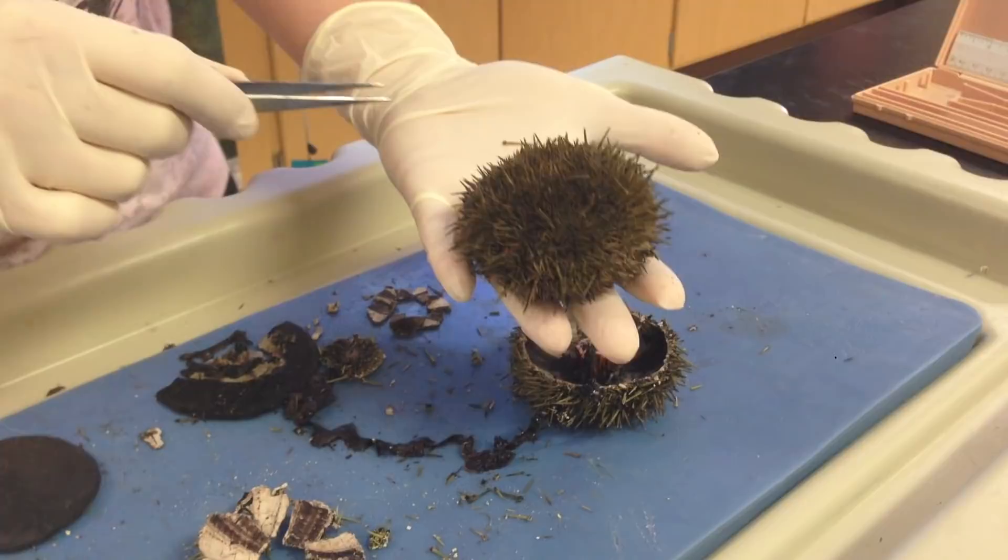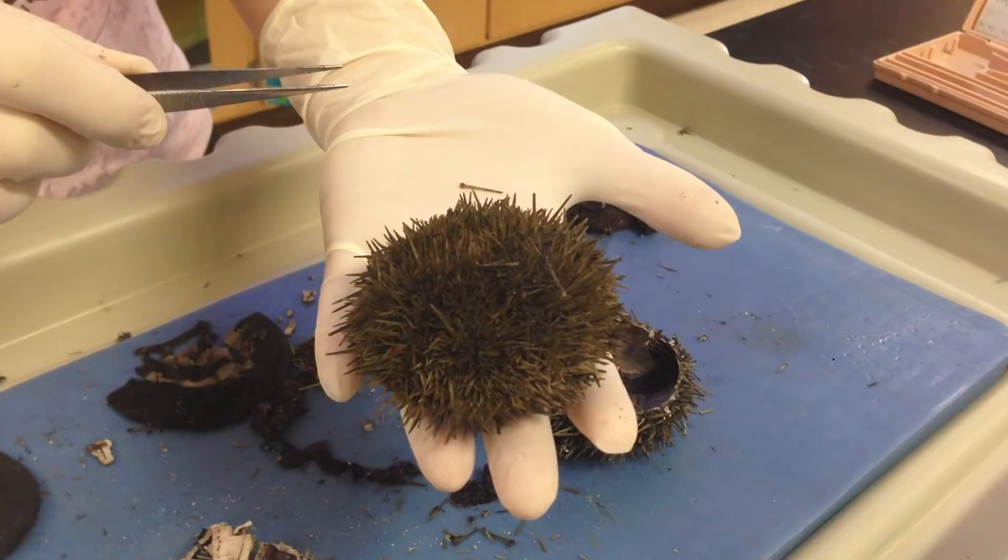What you can see here on my glove is one of the spines. What you're going to do is you're actually going to pick one of these off and you're going to look at it underneath a dissecting scope. So make sure you obtain one of those.